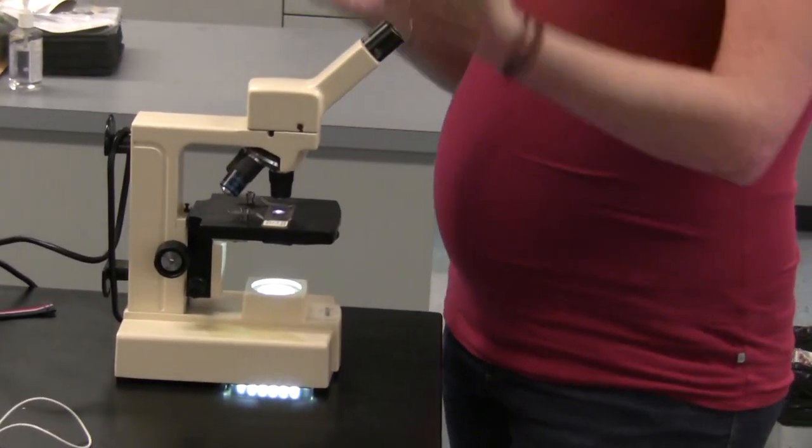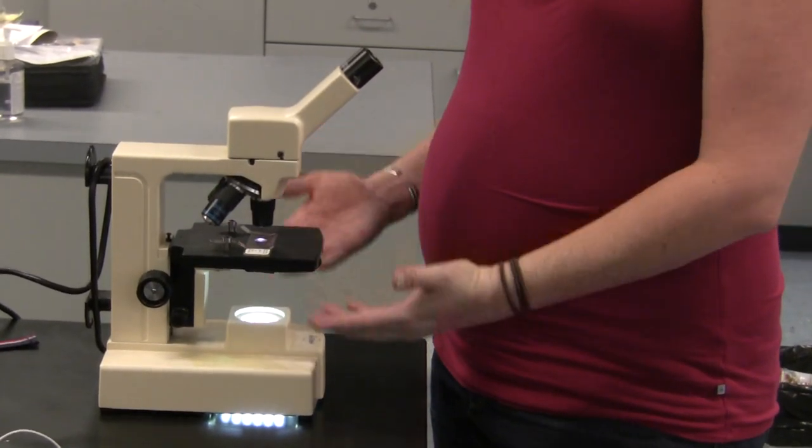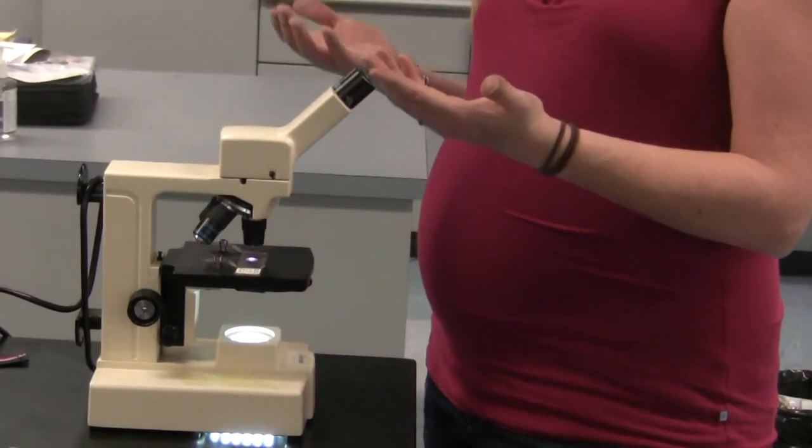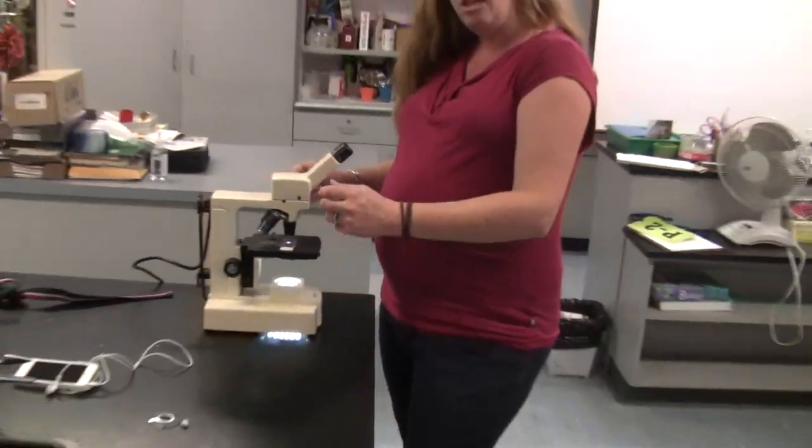The reason to put everything at the bottom first is then there's only one direction to move and you know that you're going to see it somewhere along the way. But be patient and move slowly and eventually the picture will come into view.